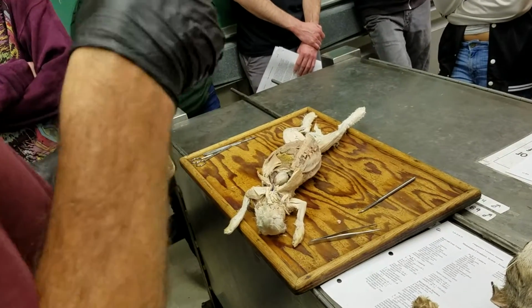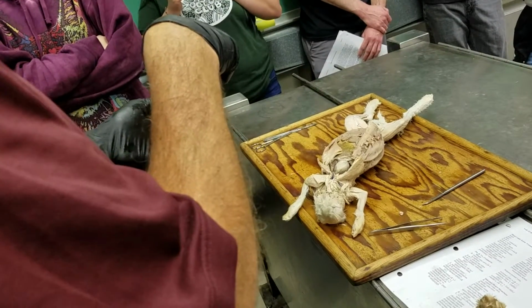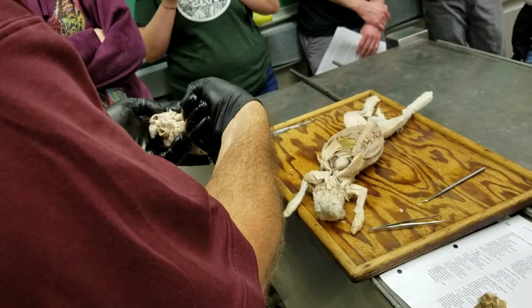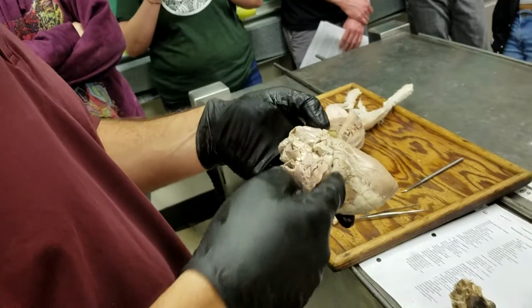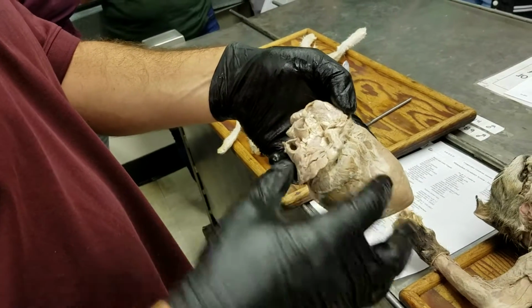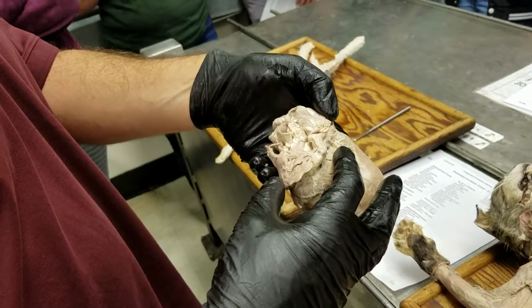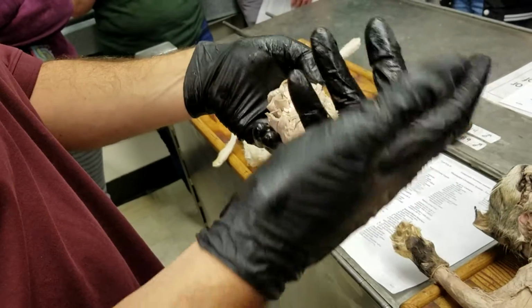And if this was a rabbit, the left cranial vena cava would come down here and across like that. They've lost that cranial vena cava. They still have this cavity or chamber here running across the backside of the heart. And that receives all the blood coming from the heart muscle itself. It's part of the coronary circulation. So that's the coronary sinus.